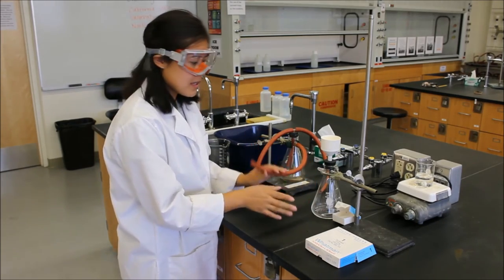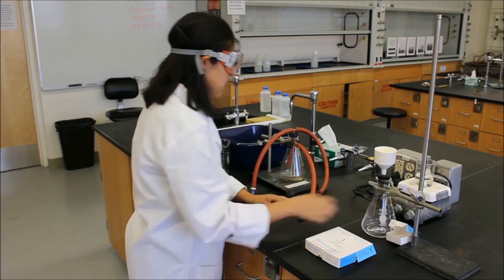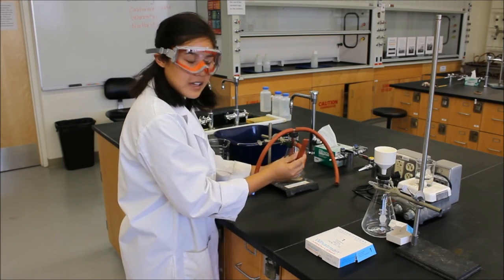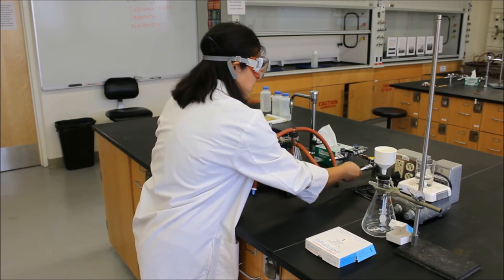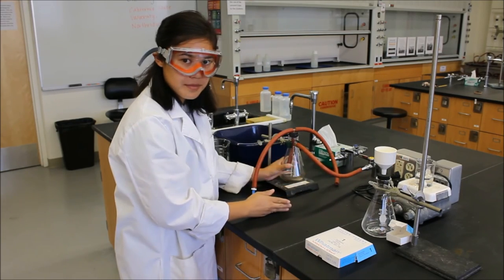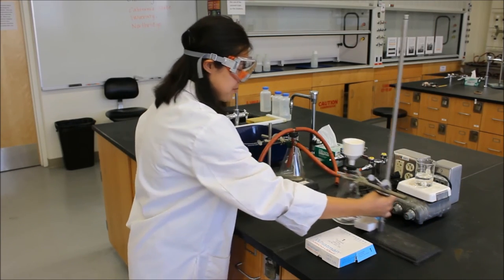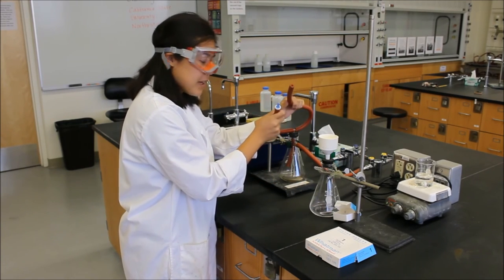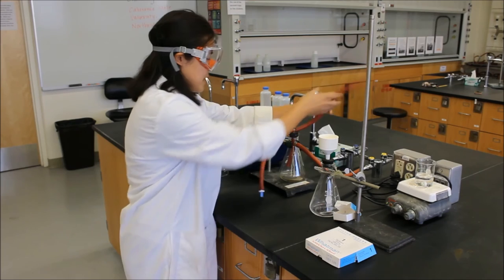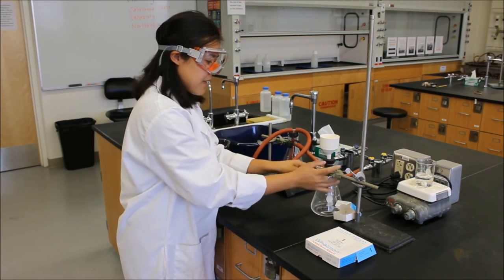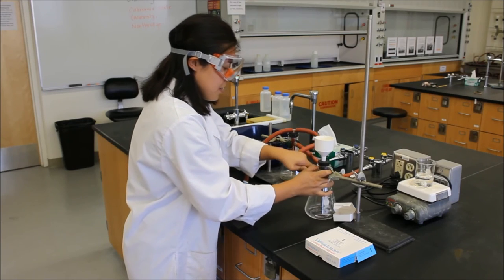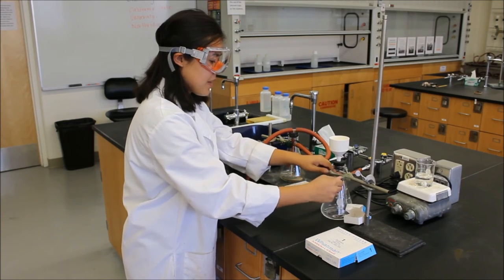How do you connect all of this trap? First, you'll want to connect this tubing coming out of this flask into the vacuum line. Afterwards, you're going to take one of these two guys here, the one that's not capped preferably, and connect it to this flask here.